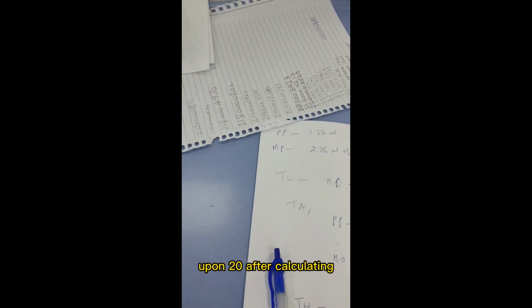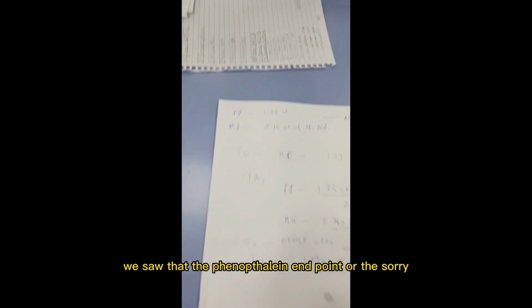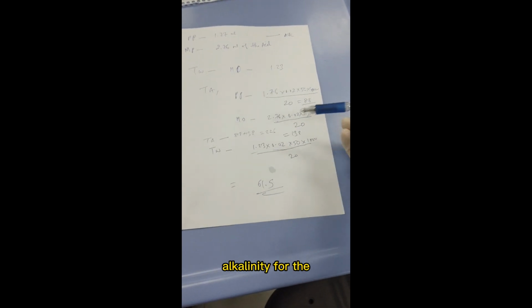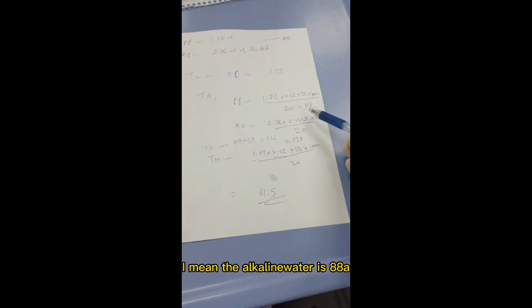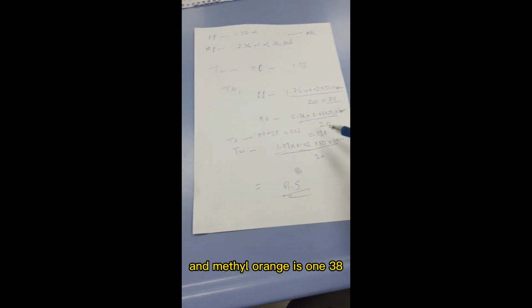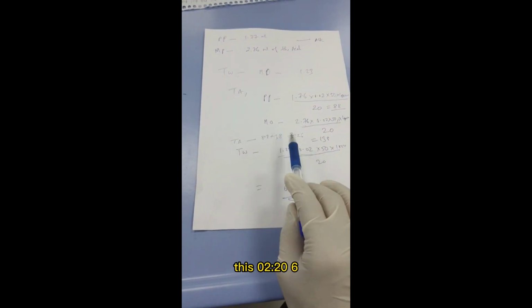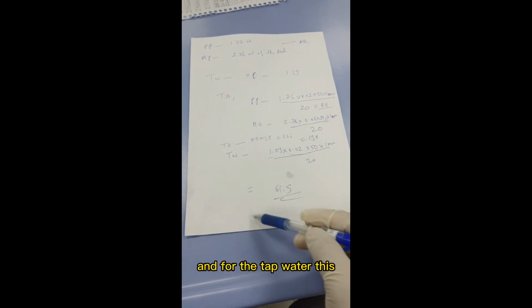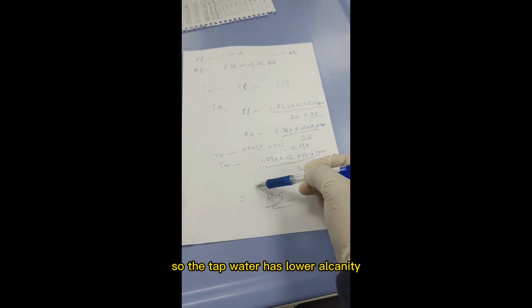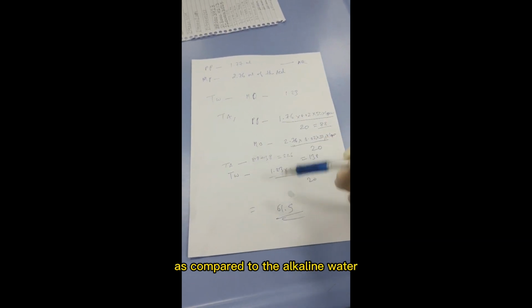Similarly for the tap water, it would be just 1.23 into 0.02 into 50 into 1000 upon 20. After calculating, we saw that the phenolphthalein alkalinity for the alkaline water is 88, and methyl orange is 138. So the total alkalinity is the sum of the two, which is 226. And for the tap water, which is very low, this is just 61.5. So the tap water has a lower alkalinity as compared to the alkaline water.